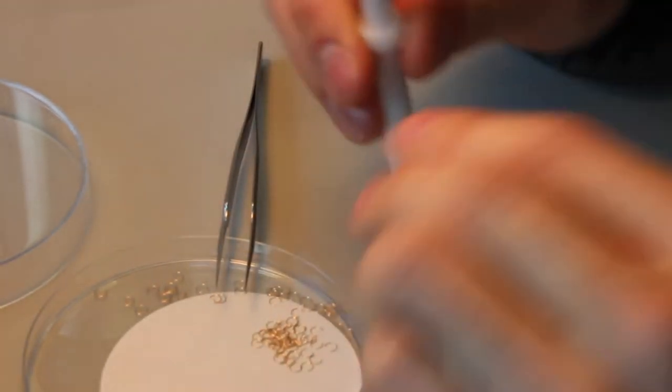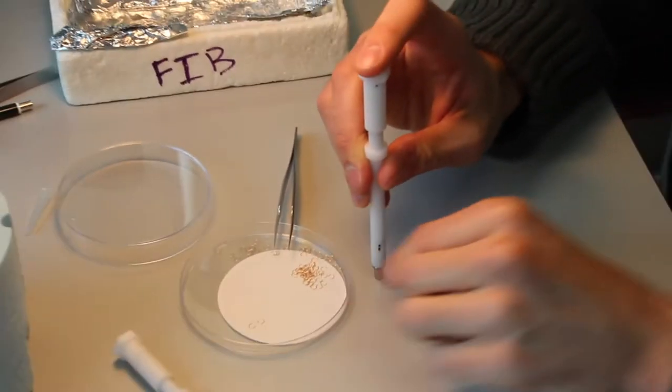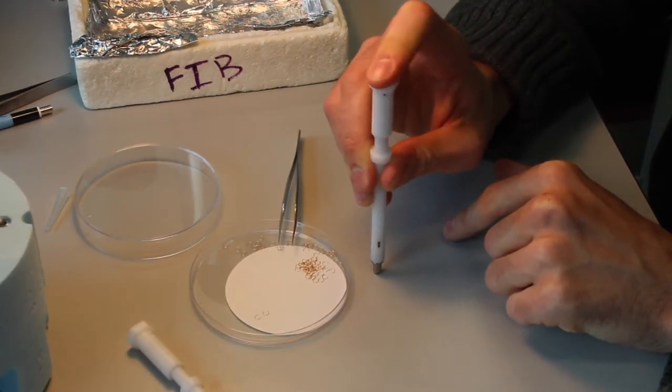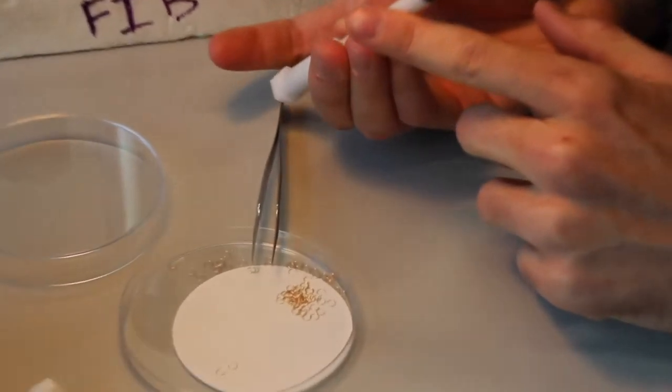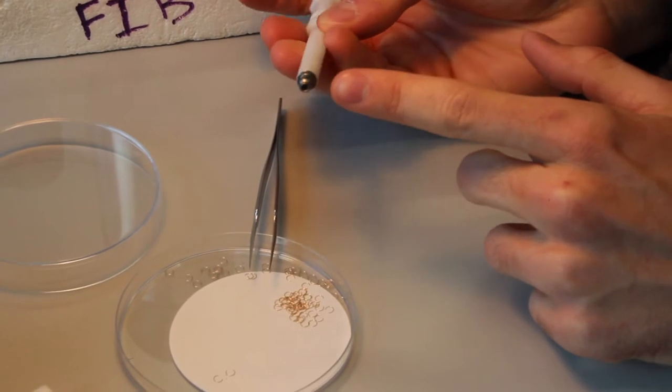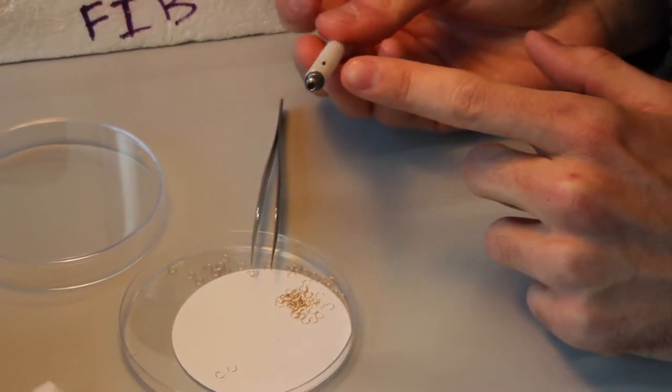Then using the tabletop, hold it flush and press down on the top a couple of times. You should now have the ring inside the tool as such.